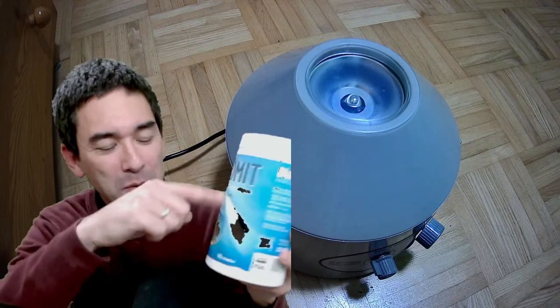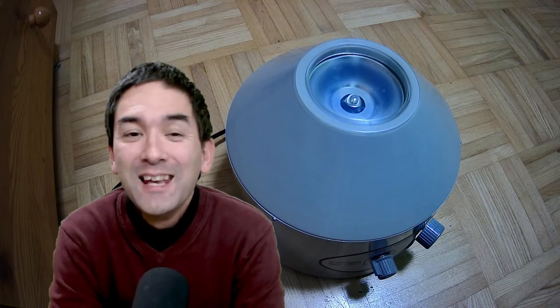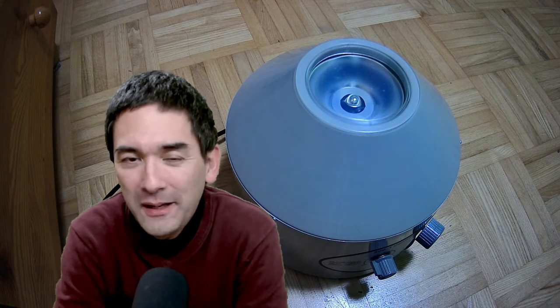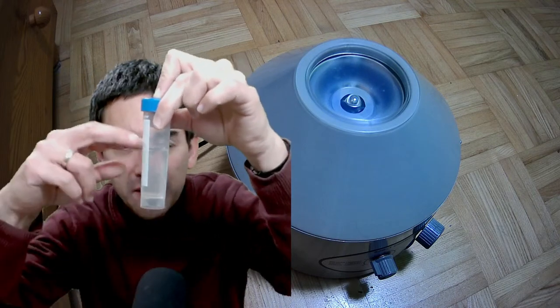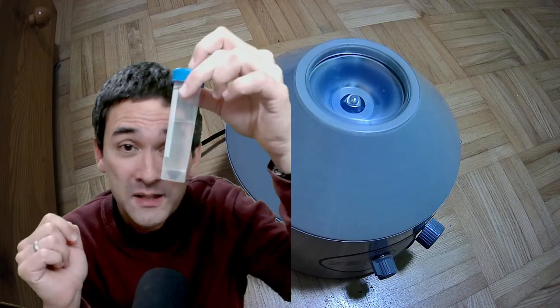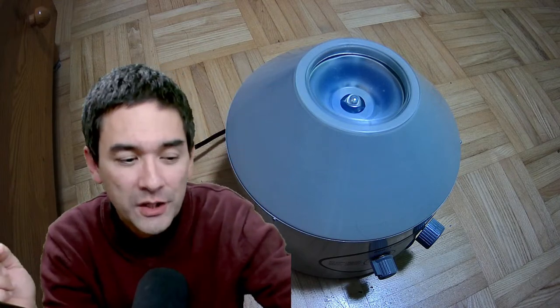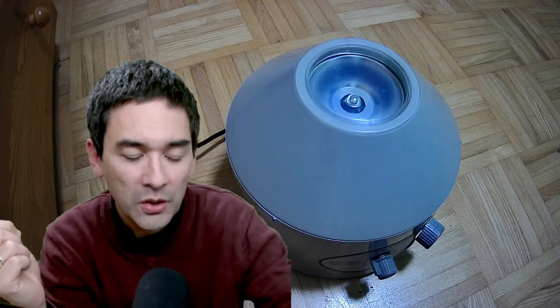This is diatomaceous earth — a very fine powder that also looks nice under the microscope. A centrifuge is not absolutely necessary but it's nice to have because it allows you to concentrate samples. It's also possible to simply let the sample stand for a few hours — some organisms will settle down, and some will float to the top because they want to go toward oxygen. The centrifuge does have certain advantages but it's not essential.